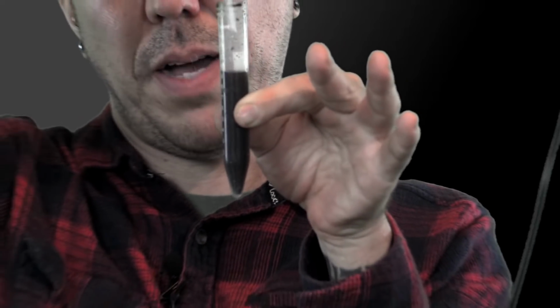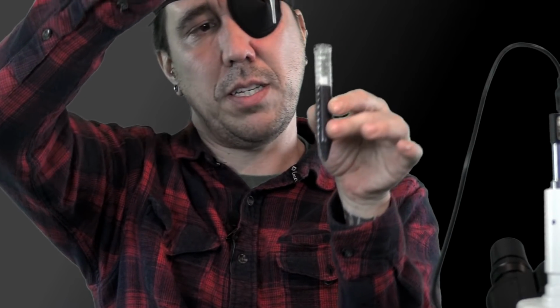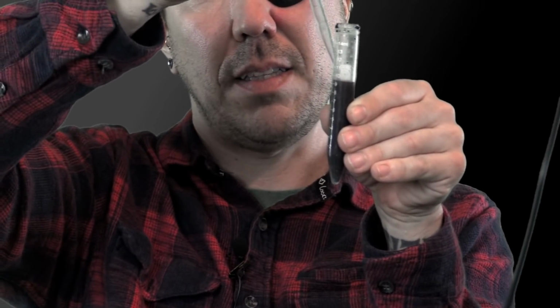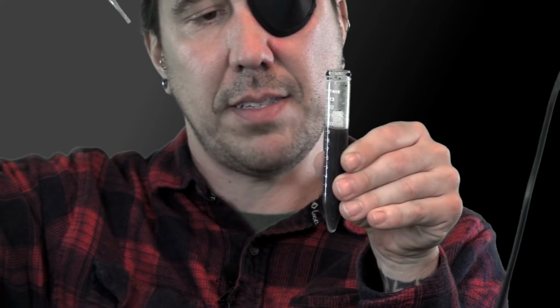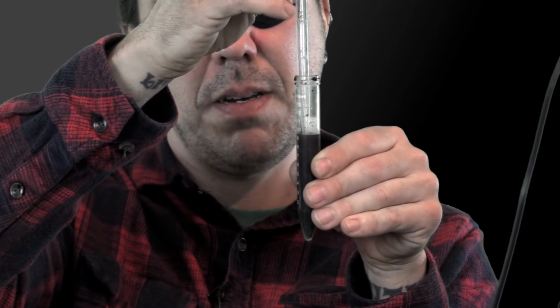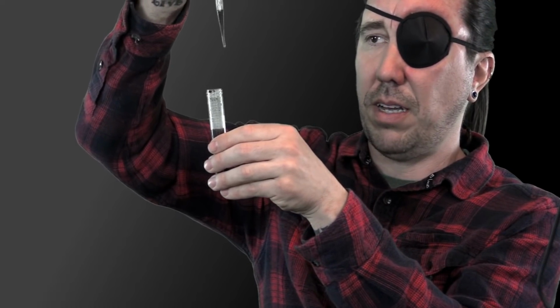And then I'll stick my pipette halfway down the solution there, because the bottom's going to have a lot of junk and the top is going to have less substance. So in the middle there, it should be even. And then I'll draw some up, and then I'll let that sit for just a few seconds like that.